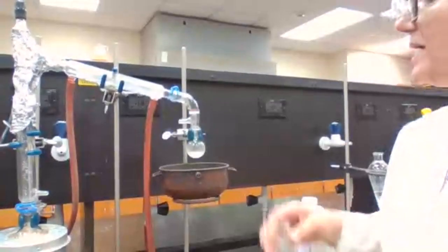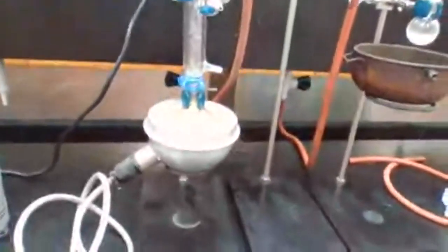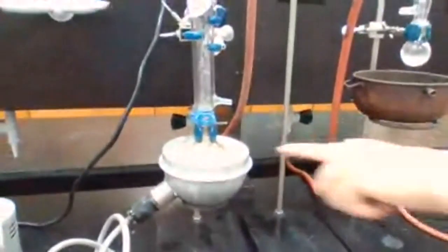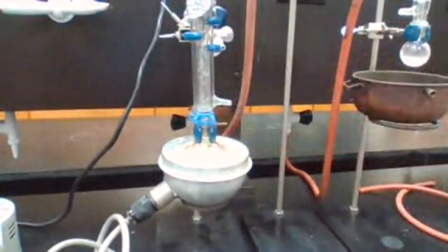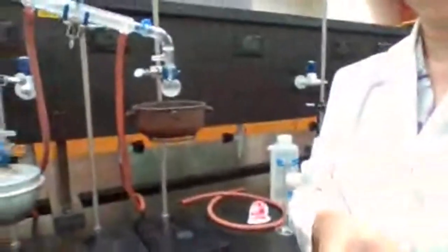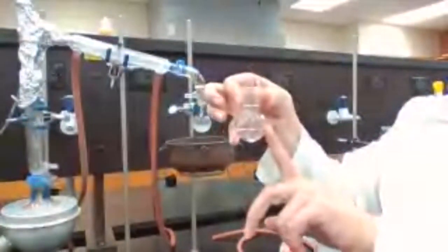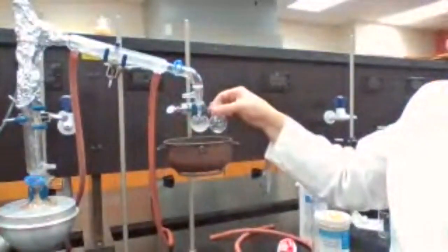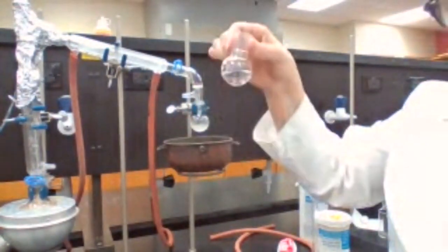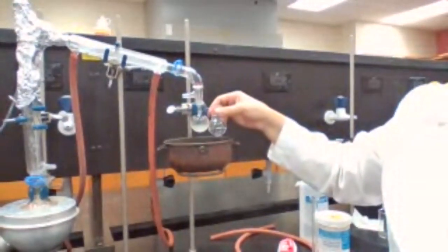If it gets foggy, it's good. Okay, that's talking about the boiling flask. If it gets foggy, which is not foggy yet, then we stop. But here, if we have anywhere between 8 to 10, we can stop. I explained this procedure before, estimating the volume in a boiling flask. You take a same size flask, take 8 to 10 milliliters of the liquid in, hold it next to it, then you can estimate.